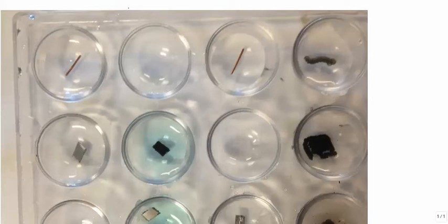Okay, so let's interpret what this metal activity lab is telling us. Here's a typical result, and what exactly does that mean? In this first well, it appears that we have some magnesium ions. That's in the liquid. You can't see them, they're just dispersed in there. Nitrate is in there as well, but nitrate is just a spectator ion, so we don't care about it.